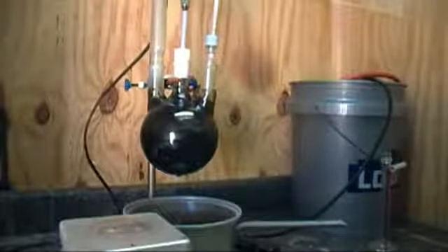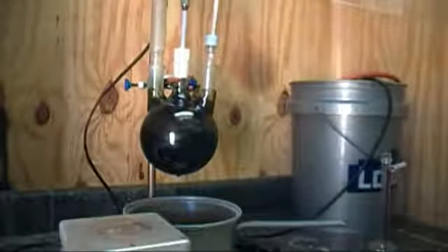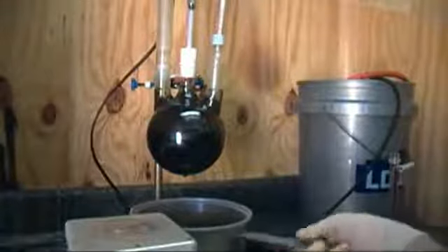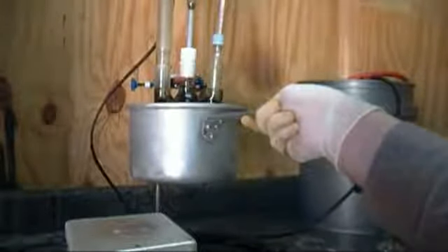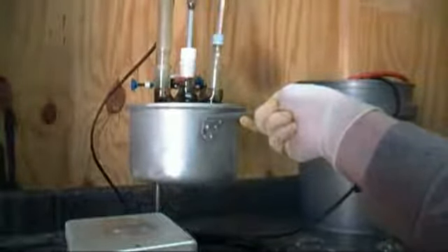Now add an additional 3-4 milliliters of nitrobenzene. You'll notice the temperature starting to rise after a few seconds. You want to maintain a temperature between 80-90 degrees C. If it gets hot, you'll need to cool with a water bath. When the temperature starts to drop, add more nitrobenzene. It took me about an hour to add all the nitrobenzene.